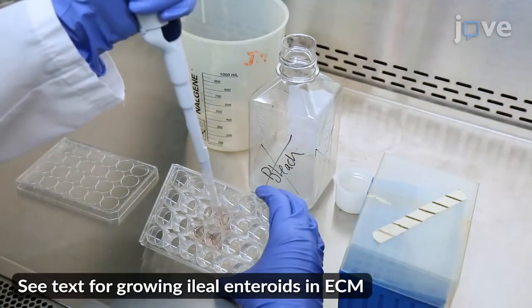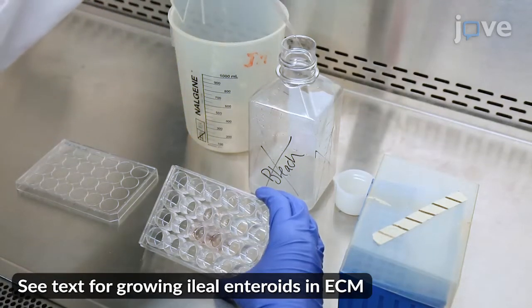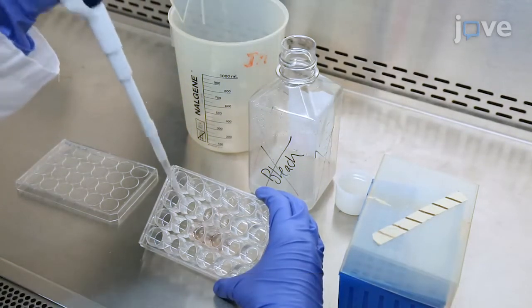Remove the plate of ileal enteroids from the incubator and gently remove the culture media from each well by vacuum aspiration or with a pipette.